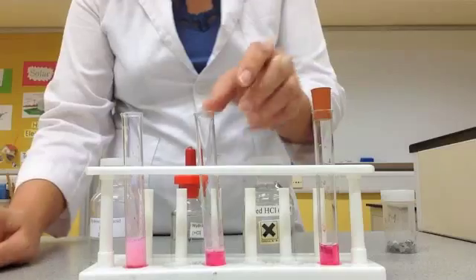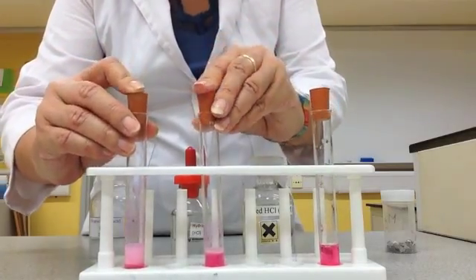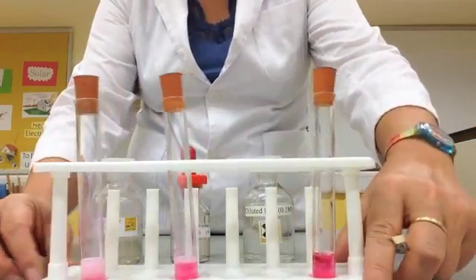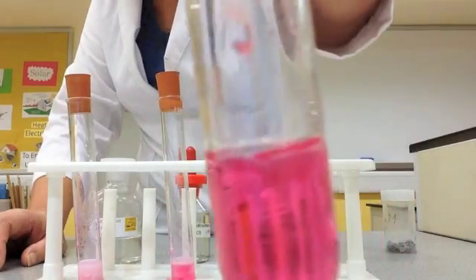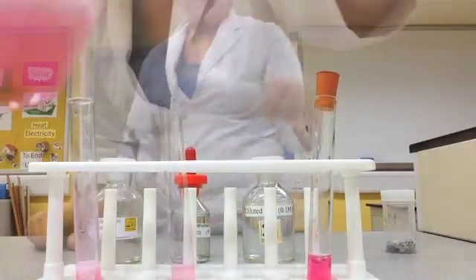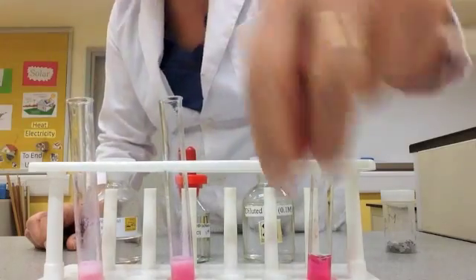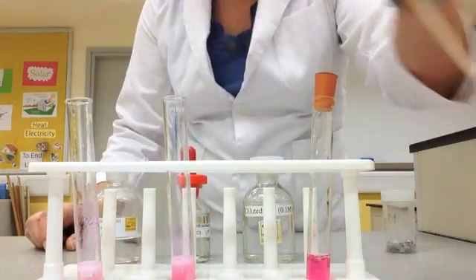You can see this one popped first because we put the strips first, but if we put the same thing on at the same time, which one do you think would pop first? Look at the amount of fizzing in the three different test tubes. There is some bubbling, but not as much. In the 1 mole and 2 mole, look at that — the reaction is happening much faster.